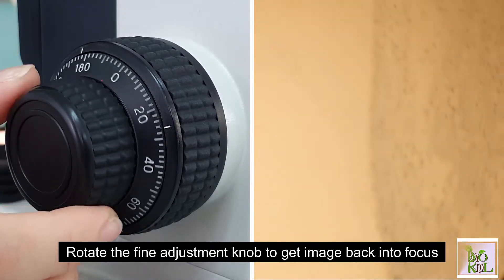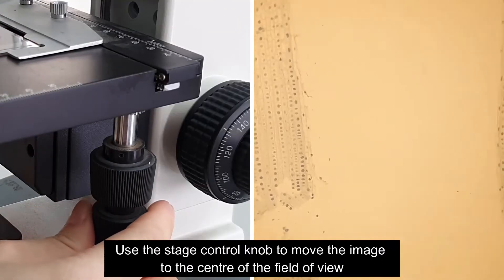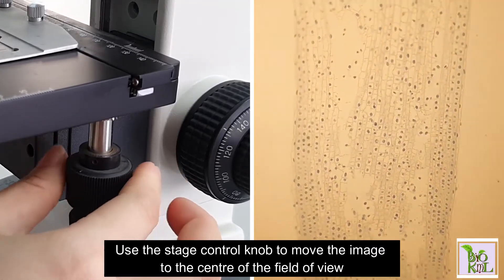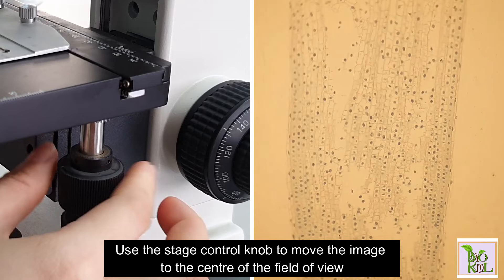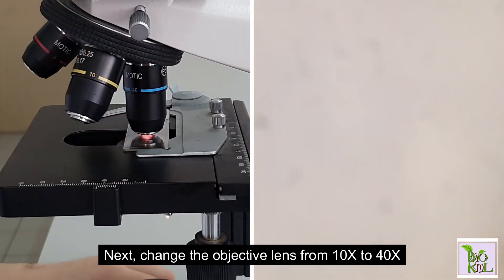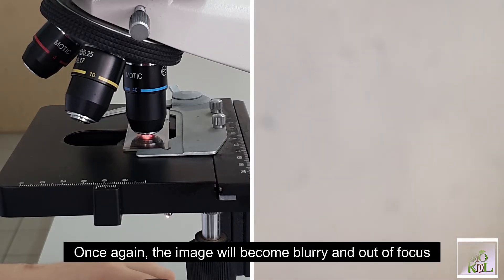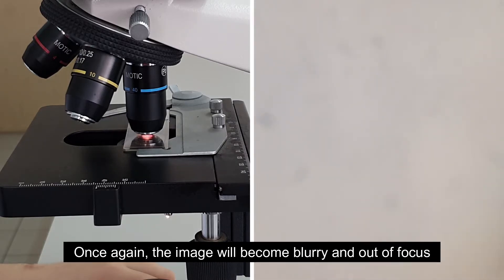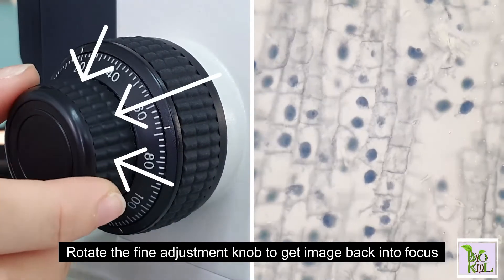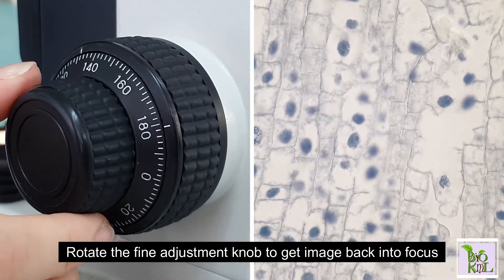The image will become blurry and out of focus — don't worry. Rotate the fine adjustment knob to get the image back into focus. You can use the stage control knob to move the image to the center of the field of view. Next, change the objective lens from ten times to forty times; once again the image will become blurry. Rotate the fine adjustment knob to get the image back into focus.